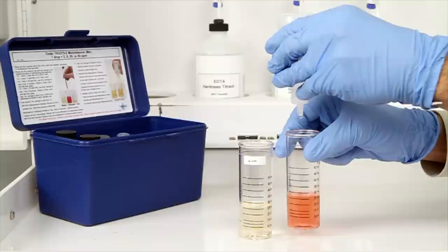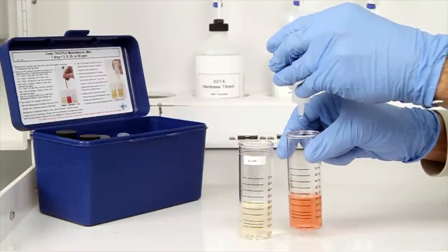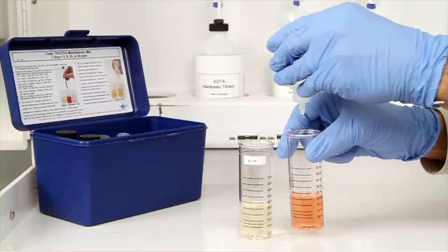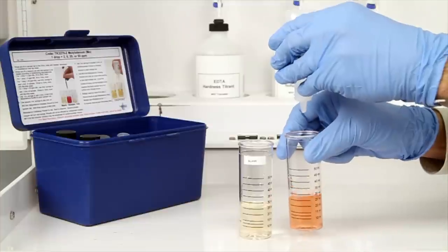Remember to hold the bottle vertically to make sure you get a consistent drop size. Swirl the vial after each drop of titrant to make sure the sample is properly mixed.